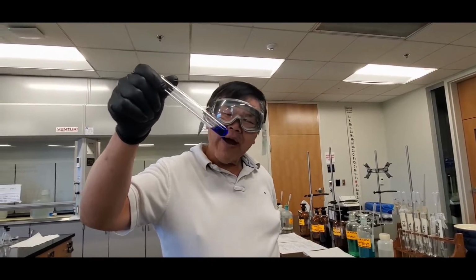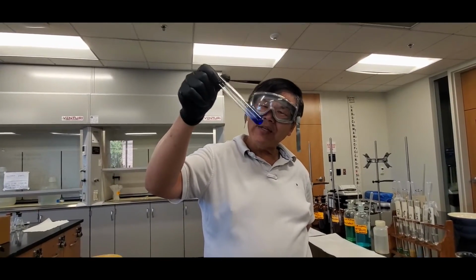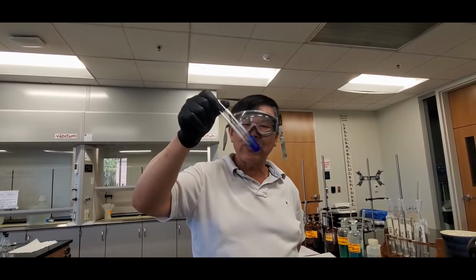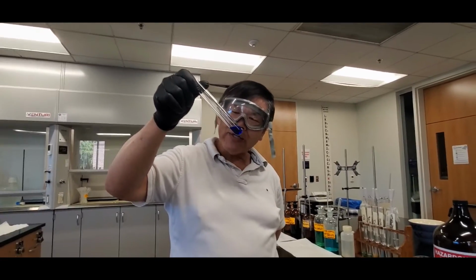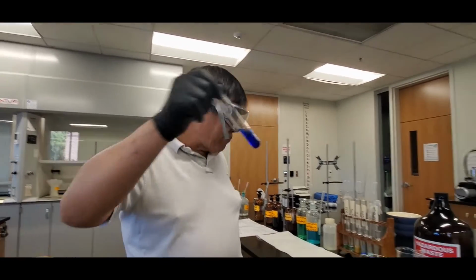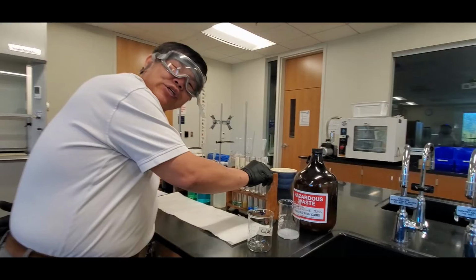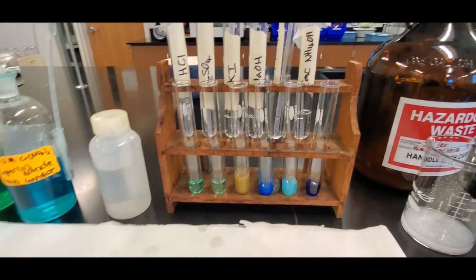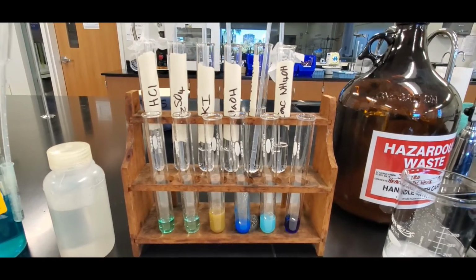In fact, this is the most sensitive test for copper. Say, for example, at home you suspect you have copper leaching into water. Put ammonium hydroxide into it. You see this, go, oh dang, you just got copper in the water. Okay? Anyway, this is pretty cool. Magic trick, huh? Anyway, zoom in. Now you guys get a look at this thing, and I'll take a picture for you guys later.